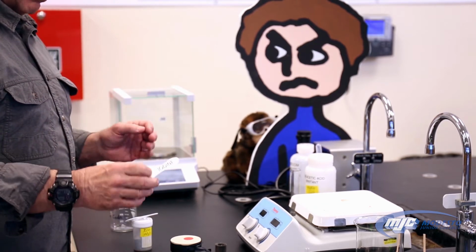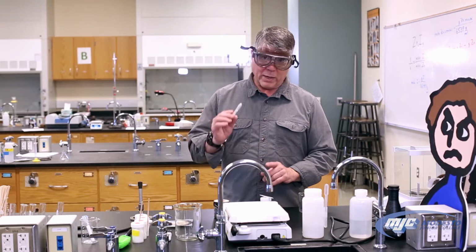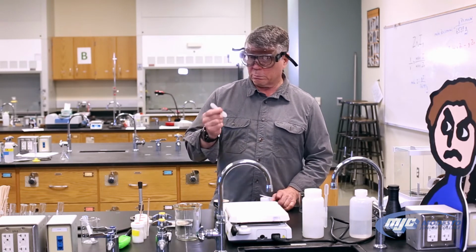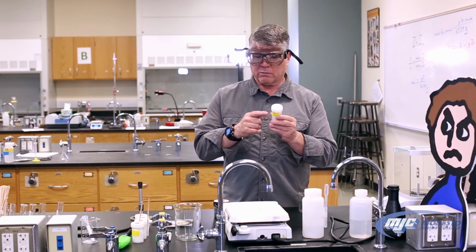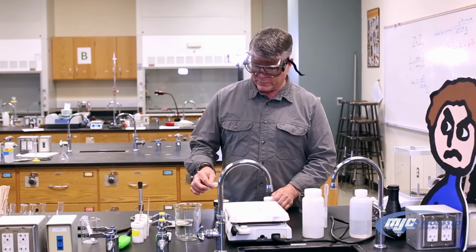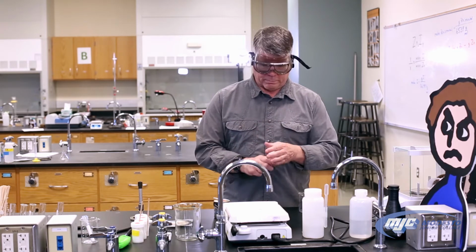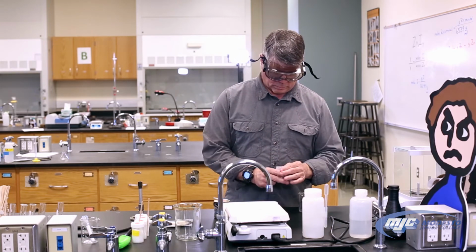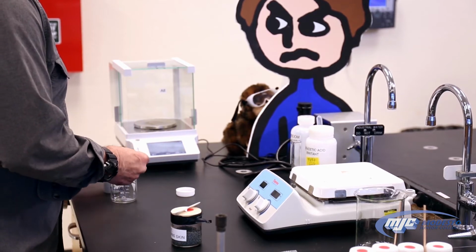And that's important because if you mix these up, you're going to contaminate the whole bottle. What has happened in the past is people have used the spoon for iodine in the bottle for zinc, and we come back the next day and this whole bottle is discolored. It's obviously contaminated. So we want to be really careful about that. But we add the zinc first. So we want about 1.2 grams. And it's not really that much.